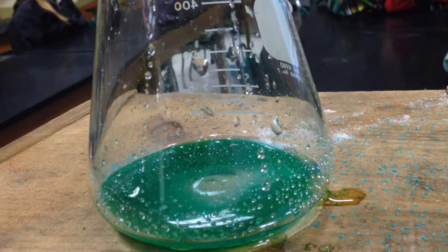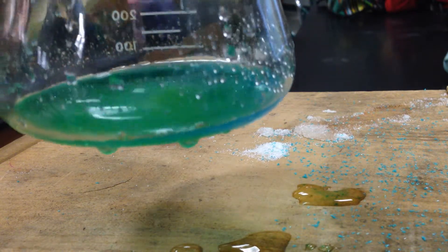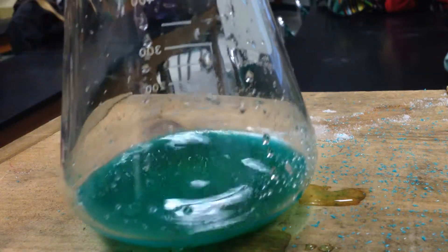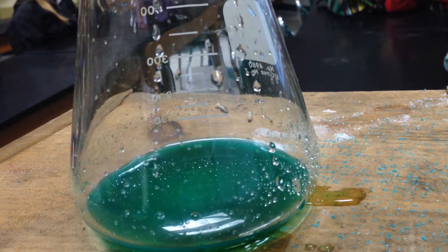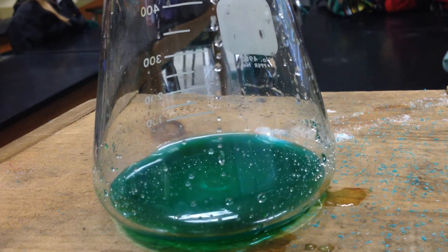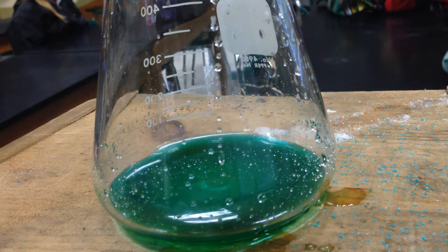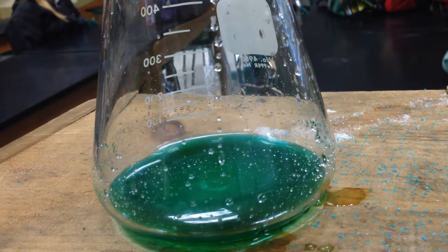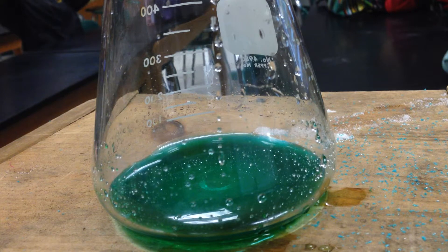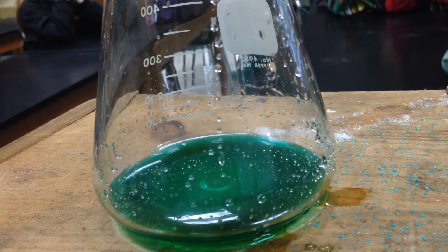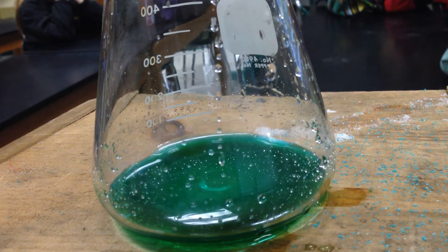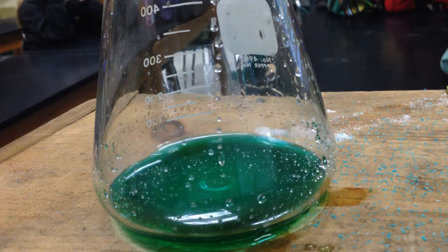We see a dark green color. At the bottom, it's green. But there is certainly a darker color. It's still green, but is it the same green as the color of the crystal? So it's changed the color. So by me putting a little bit of water and exposing some chloride ions by some dissolving here, hydration, I have chlorine ions are now the predominant ligand around the copper ions, and that changed the color.